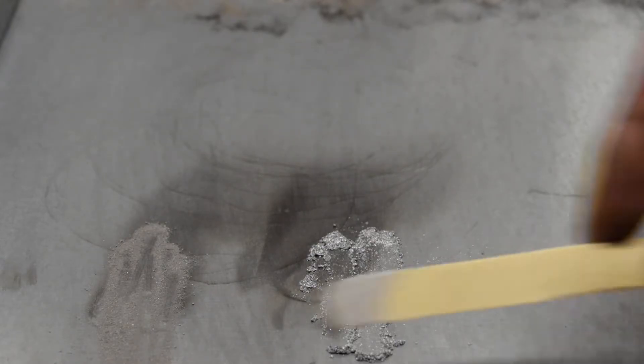This test is what I'm calling the pile test, where I'm just pouring some metal out onto the table, spreading it out long-wise, and then I'm just going to hit it with the torch on full blast and see what happens.